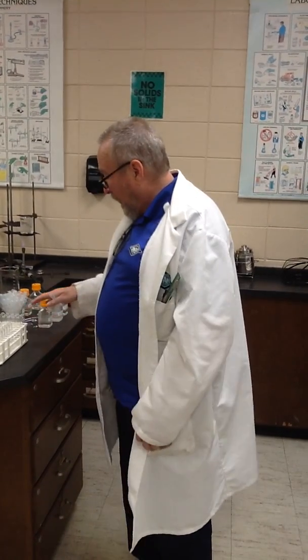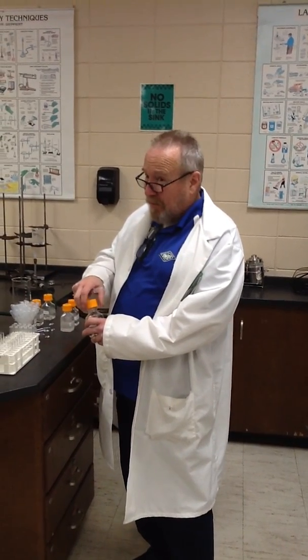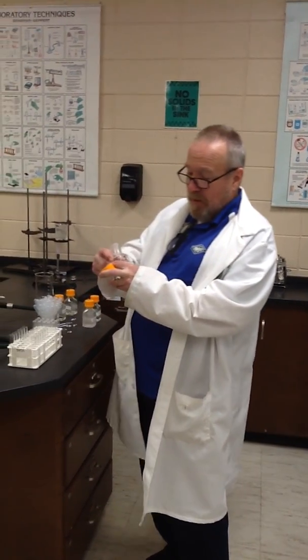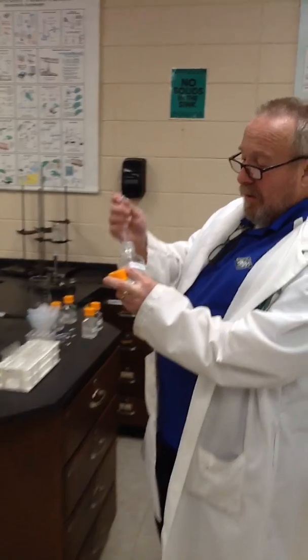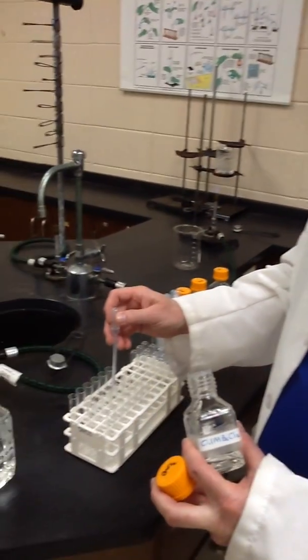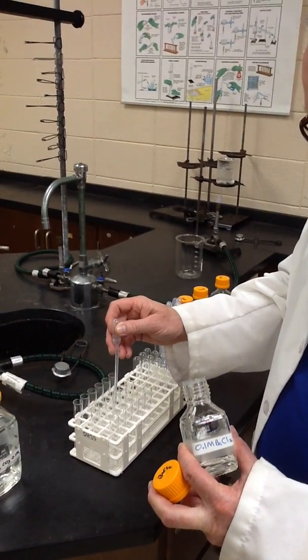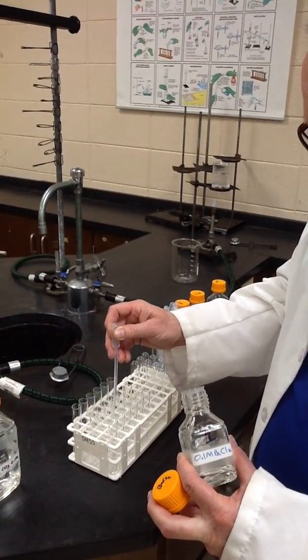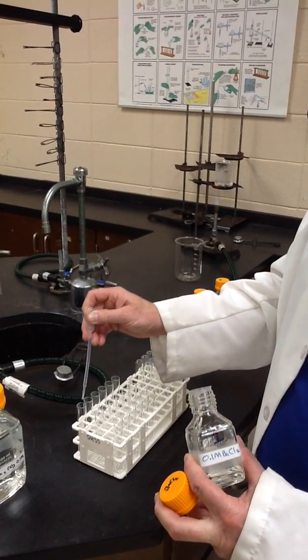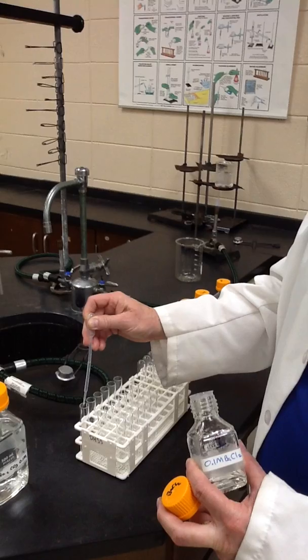So, I'm going to set up my tubes 1 through 6 and set them back up because we would still be using the previous tubes, and do what it says, which is add 10 drops of, in number 1, barium ions, which is barium chloride. 1, 2, 3, 4, 5, 6, 7, 8, 9, 10 drops.